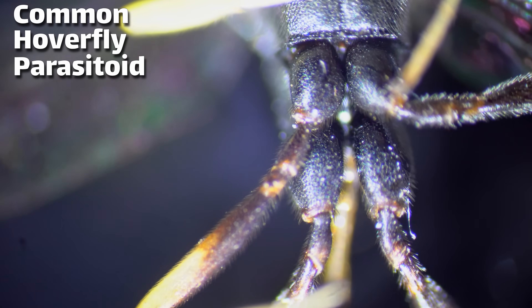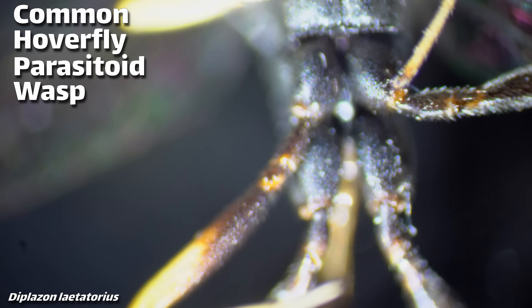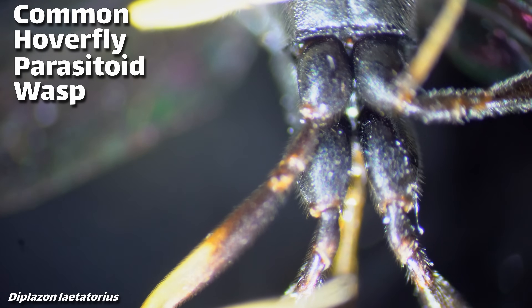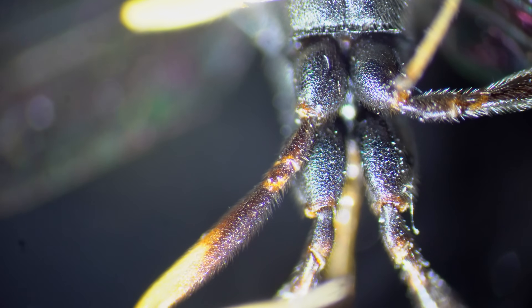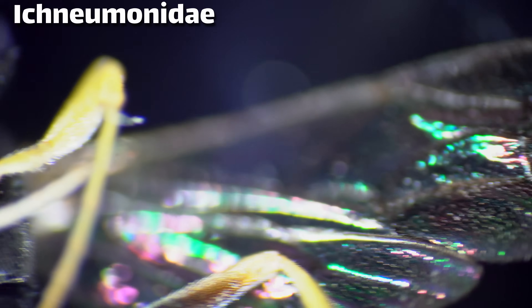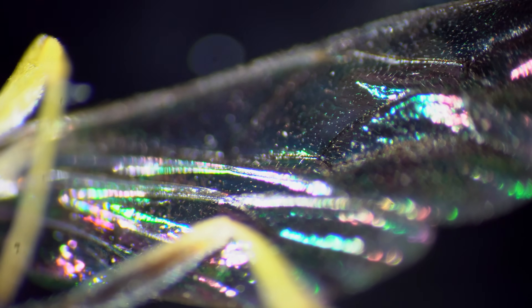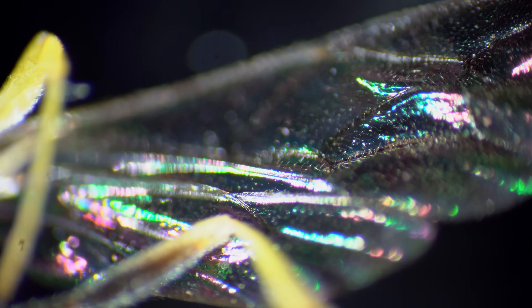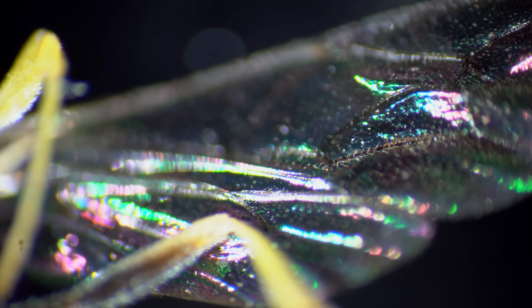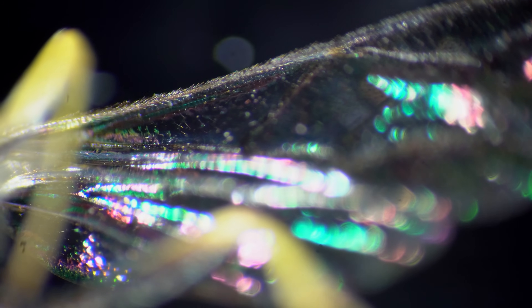This insect is known as a common hoverfly parasitoid wasp, and its name tells you a lot about its lifestyle. It's a wasp, and it belongs to the Ichneumon family. This family is estimated to contain upwards of 100,000 species, of which only about 25,000 are known and described in any great detail.